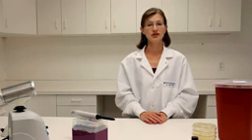In this video, I will explain the serial dilution process and demonstrate how to perform dilutions when using the Microbiologics e-Power product. Dilution is the process of making a solution weaker or less concentrated. In microbiology, serial dilutions or log dilutions are used to decrease a bacterial population to a required concentration. The purpose is to achieve an appropriate concentration for a specific test method or to achieve a countable agar plate.